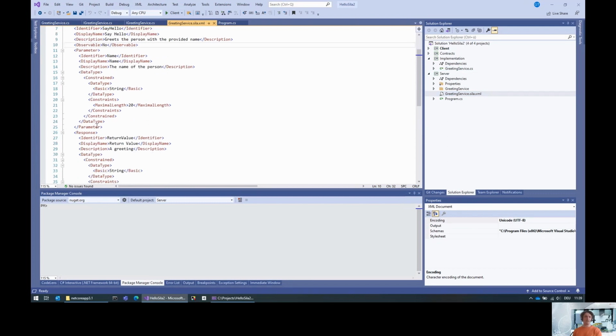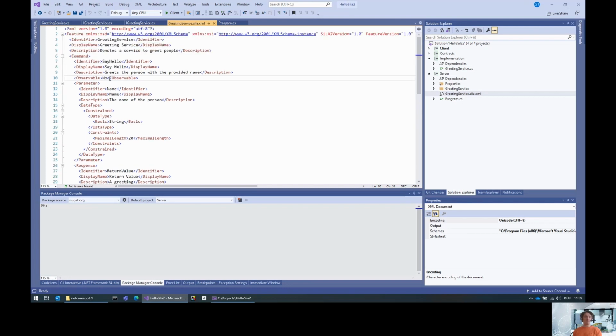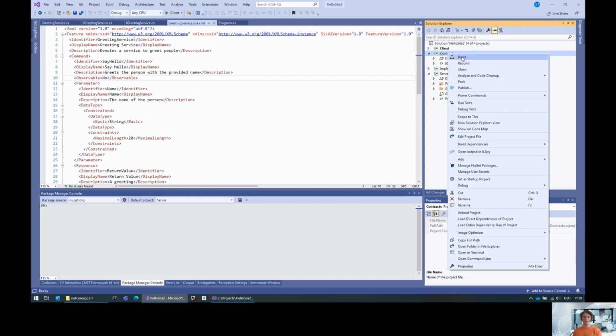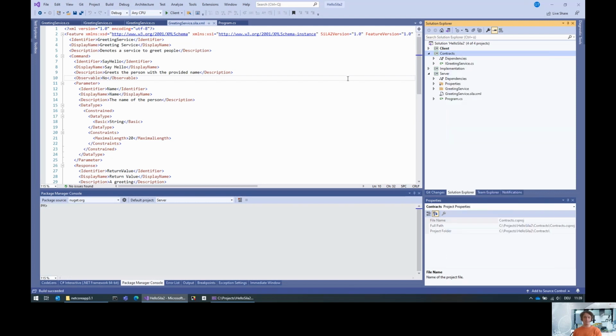Normally, the SiLA 2 standard does allow you to specify that this command is throwing an exception. Now, please do not edit this file manually because it's going to be regenerated as soon as you run the code generator again. Therefore, rather use the code generator. The code generator again uses build assemblies, so let's rebuild the contracts.